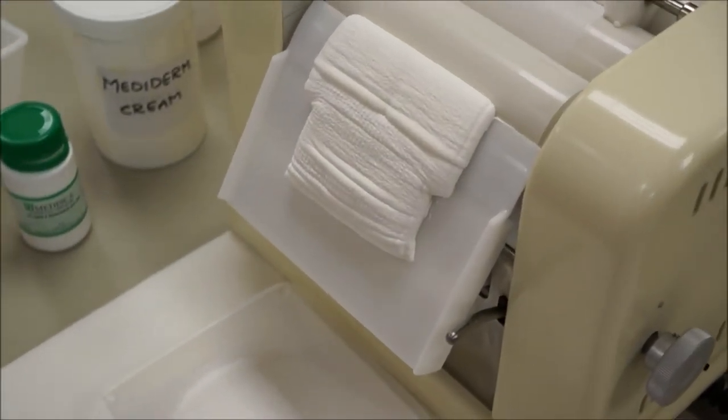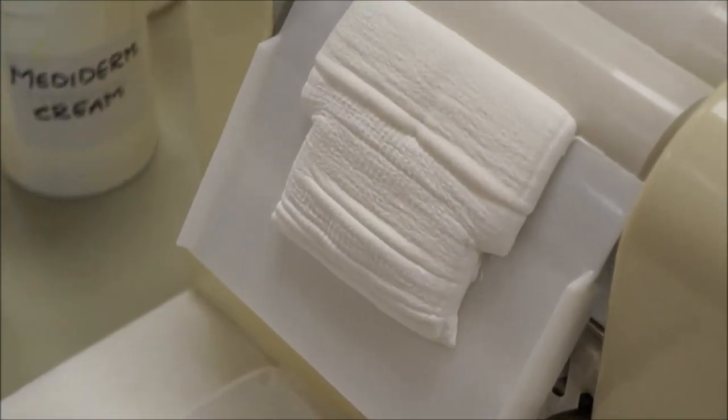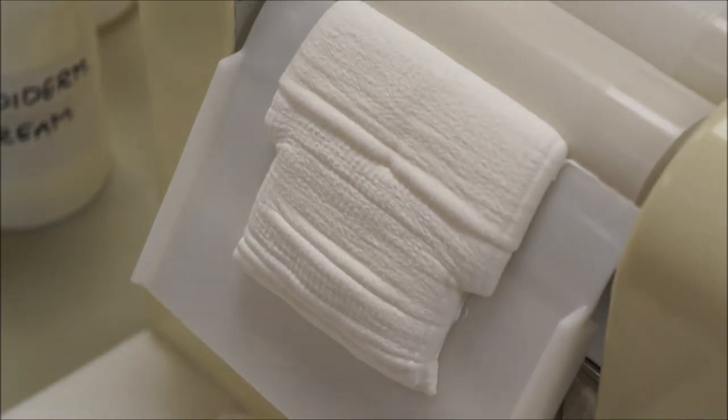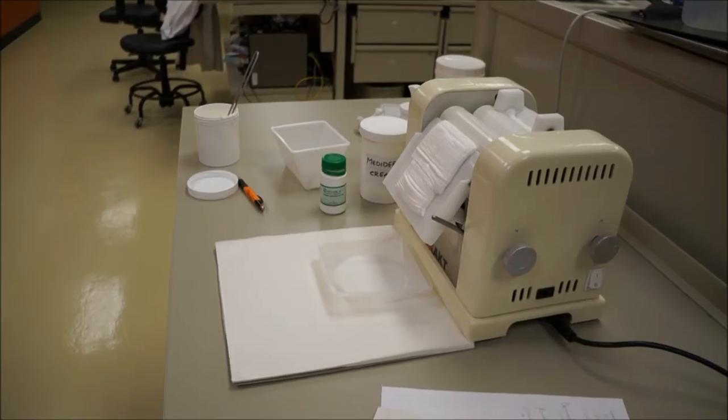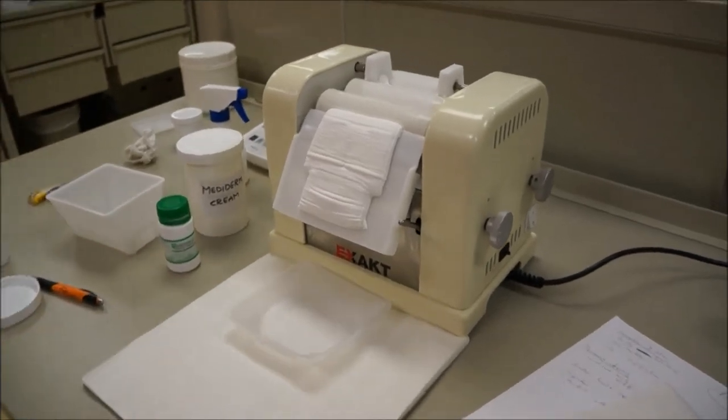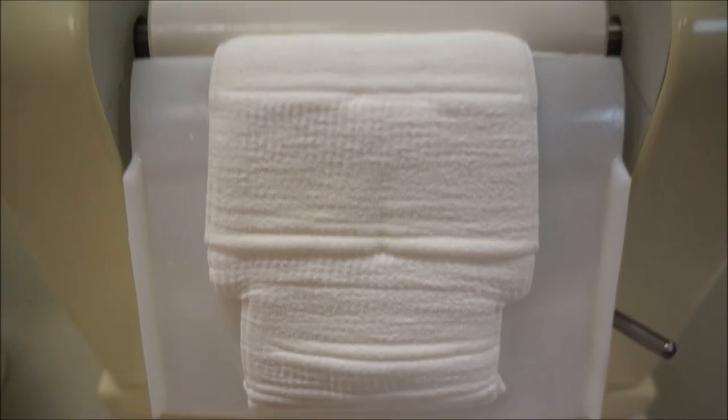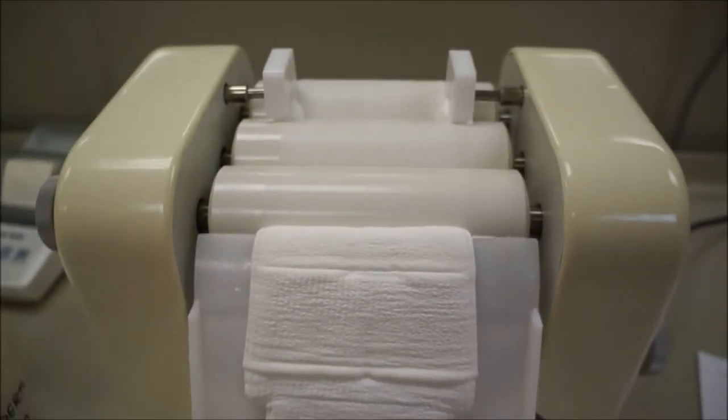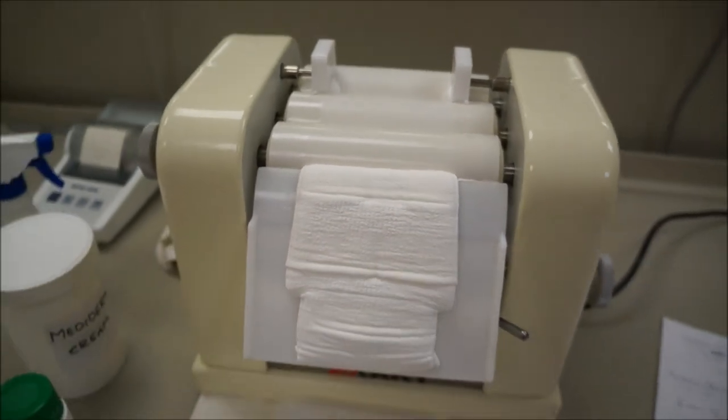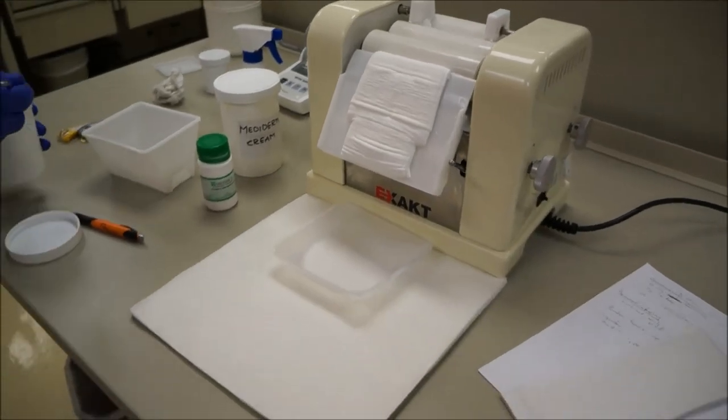As you can see, I've had a large amount of cream buildup. It's actually very smooth now. You'll be able to feel that during class as well. Now the reason for this is because those back two rollers are knocking down the particle size and the front one as well, but for a lesser part. As you've read in the book, if you have any questions, feel free to ask me or one of the other TAs during class, or Dr. Spidell or Dr. Lenke.